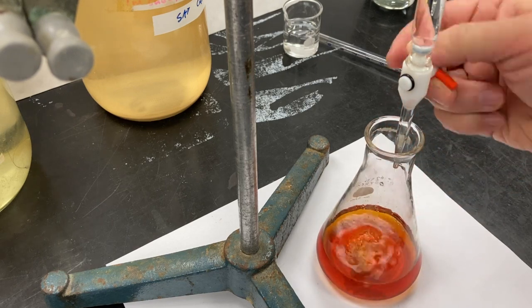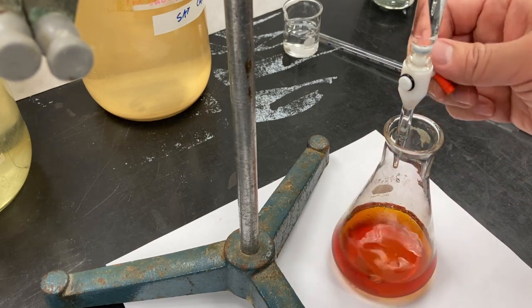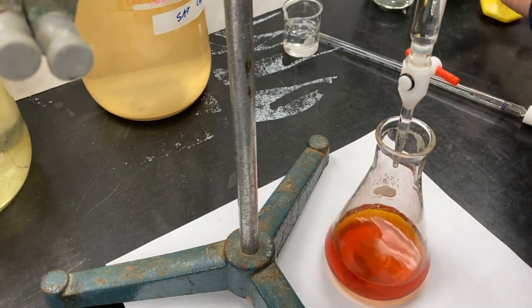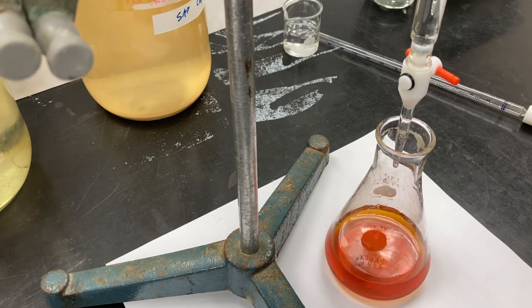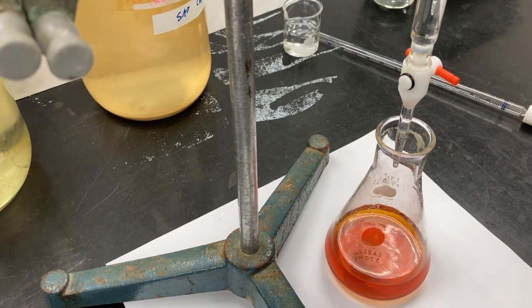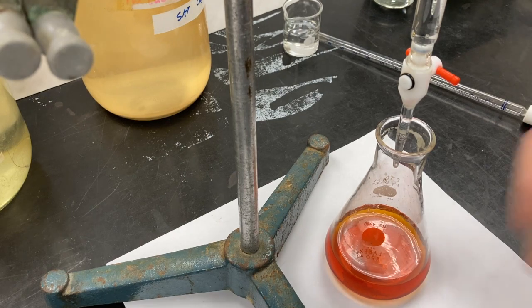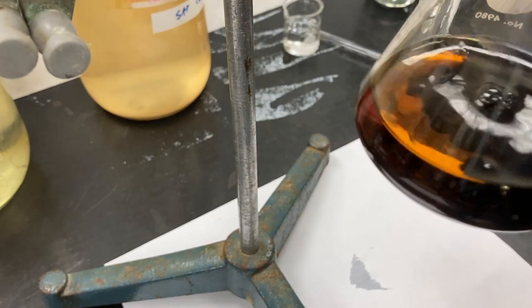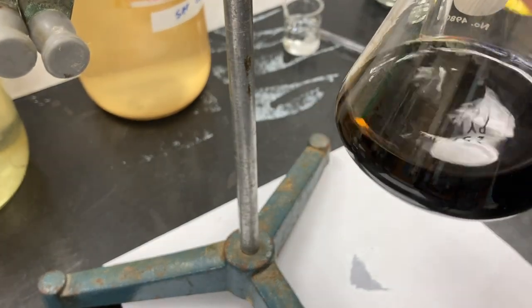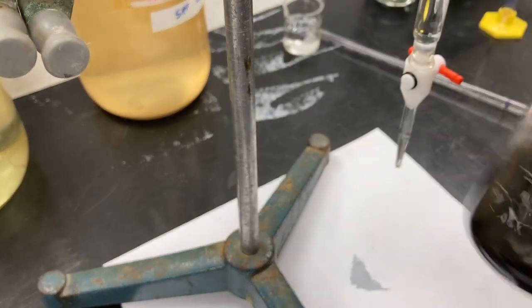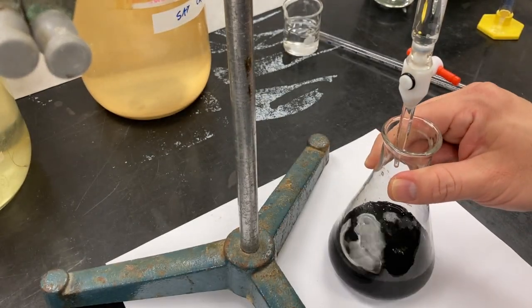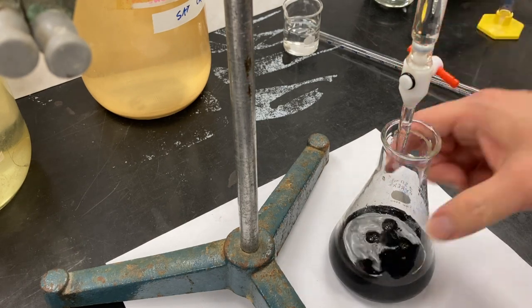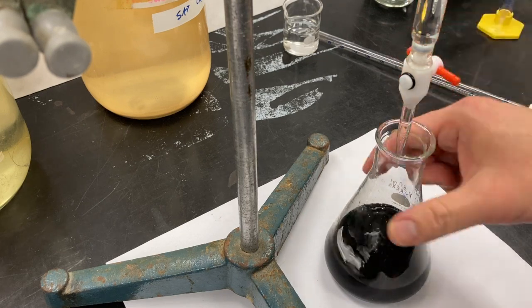You can see the color lightening already. And now it's as good a time as any. So we've got our black color due to the presence of the iodine and starch, and now we are looking for the solution to clear up.